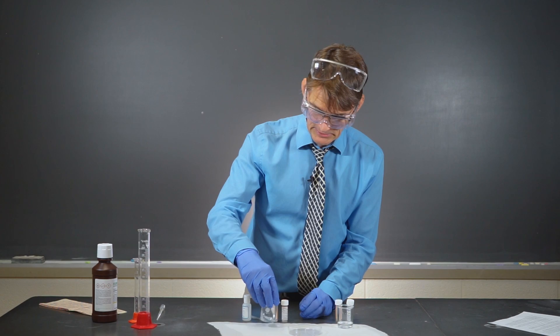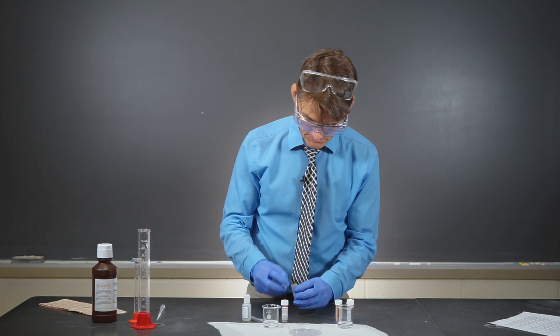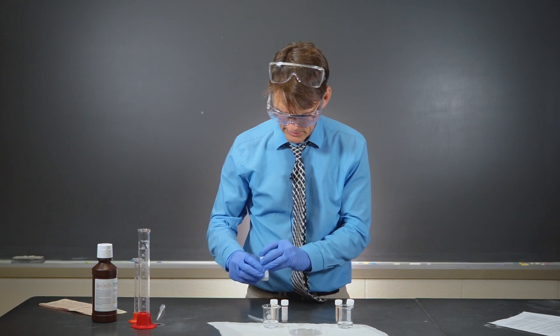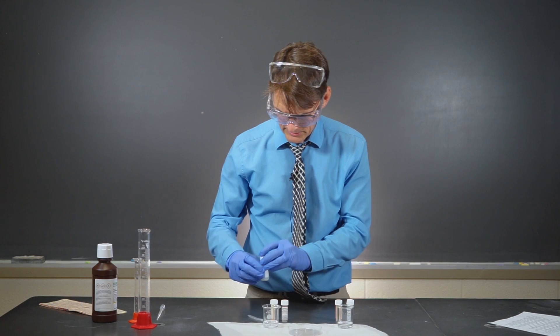Overall, this forms iodine, which is a colored species. I'm going to add a little bit of manganese here as a catalyst for the reaction. And then we're going to add a little bit of starch because that lets the iodine show up a little better. Iodine will turn black or purple, bluish-purple in the presence of starch.